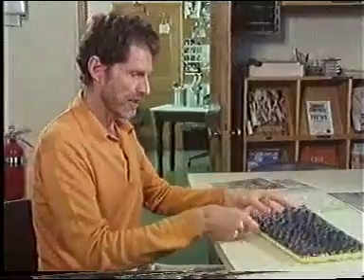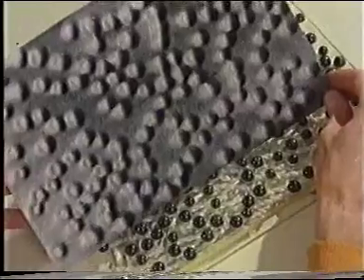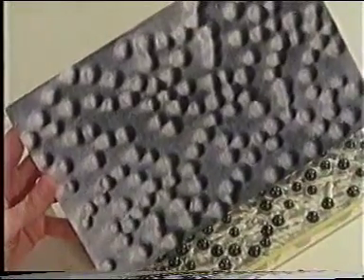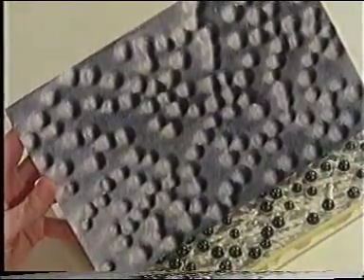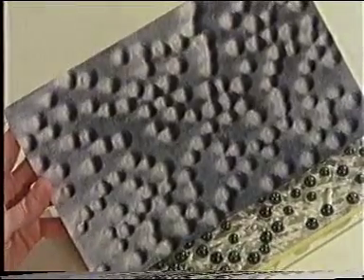Now remember, what we look at by freeze etching is actually a replica which is formed of the fractured face. And on this replica, the sculpturing we see, these bumps, represent transmembrane proteins that are exposed by breaking the membrane, by fracturing the membrane in half.